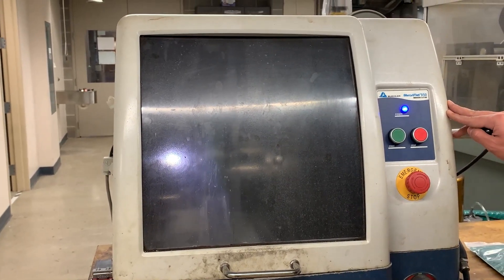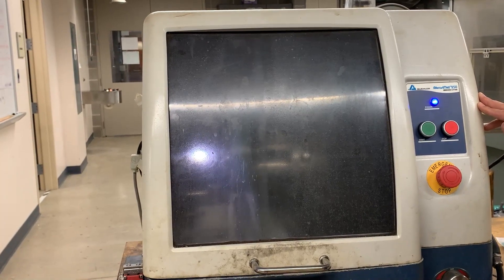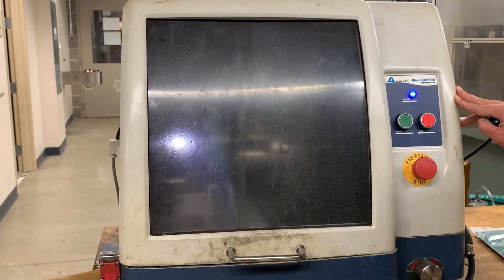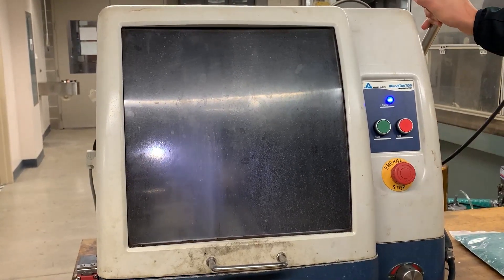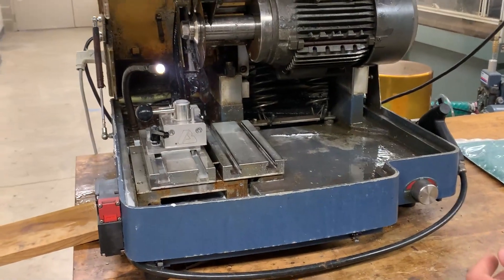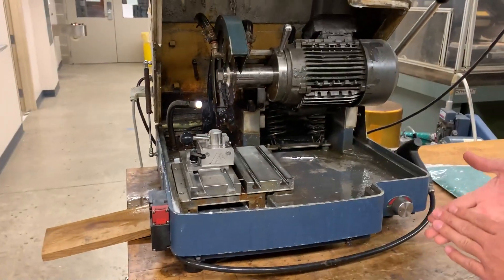Once we have that, I'm going to lower the cutting wheel slowly. We don't want to do this too quickly until we start feeling some resistance and hear the audible sound of cutting occurring. I'm going to apply just a little bit of light pressure on the handle — I don't want to push too hard or slam the cutting wheel into the clamp once we get through the bolt. You can feel the resistance lessen and hear the audible sound as we near the end. Once through, I'll raise the cutting wheel, stop the machine, open the hood, remove the sample from the clamp, and retrieve the cut specimen.